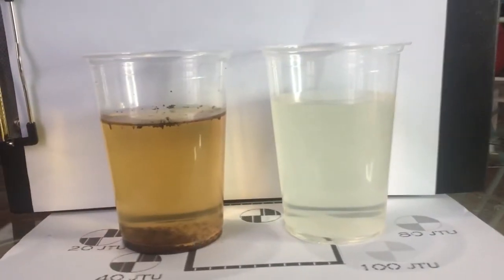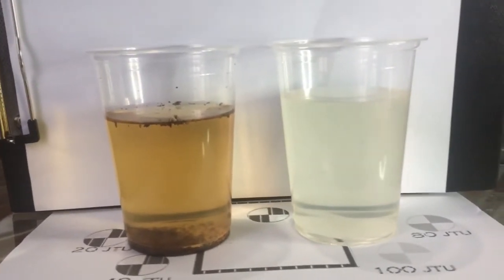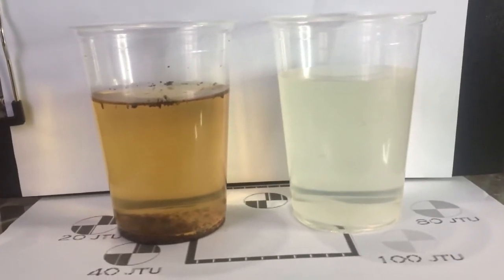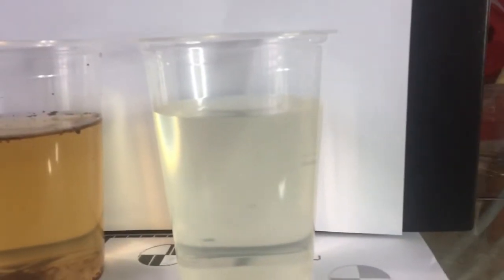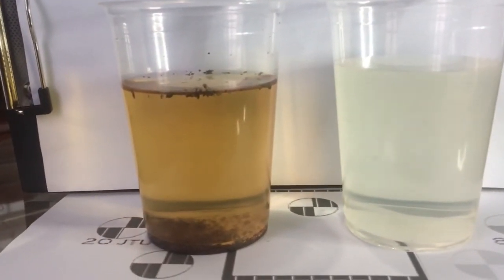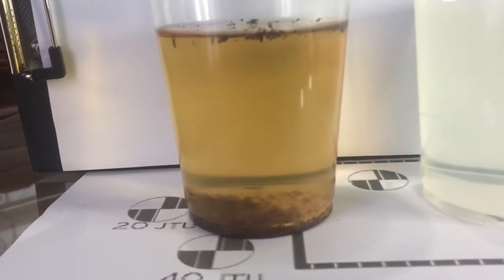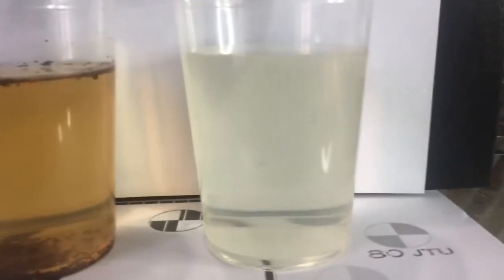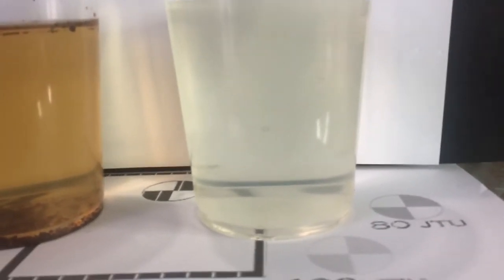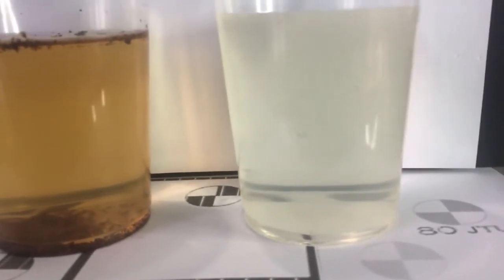So this is the difference between before and after the water is filtered. The most obvious change is that the water becomes clearer than before. It has become whiter, almost similar to the paper behind, and the darker color is here. There is sediment settled down here, but in this end product there is no settlement. There are no suspended particles, no suspended solids left in here.